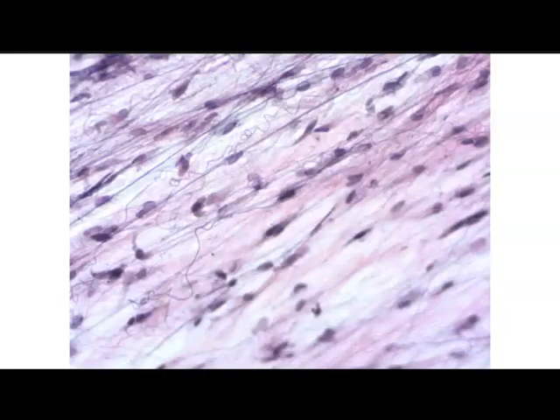These thin fibers here are the elastic fibers, and then the thicker pink staining fibers, those are your collagen fibers. However, you will not be able to see the reticular fibers as they have not stained in these slides. So again, just another slide of loose areolar connective tissue with the thin, wiry, elastic fibers, and then the thicker pink collagen fibers, and then the nuclei of the fibroblasts. And another slide of loose areolar connective tissue.